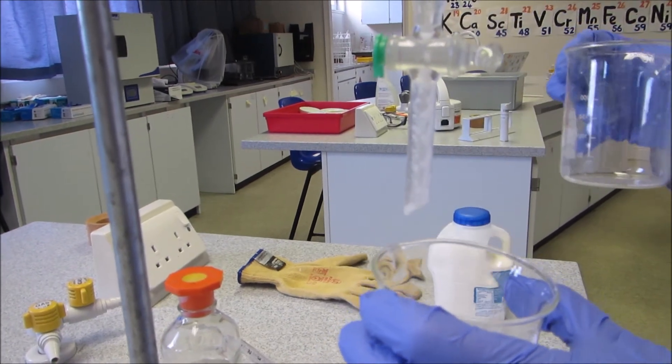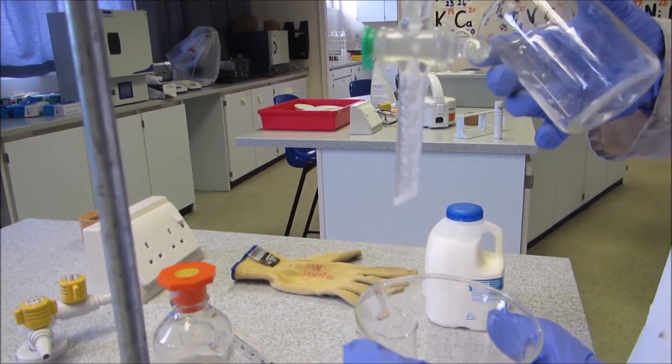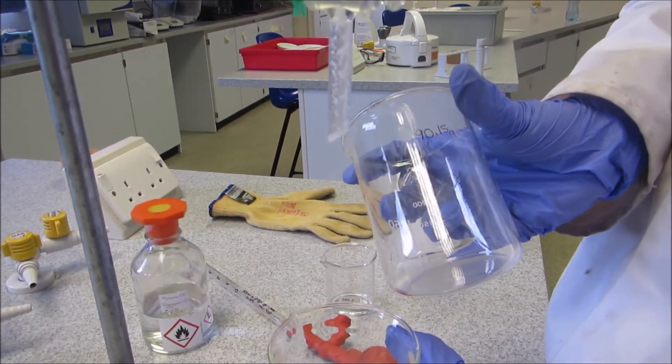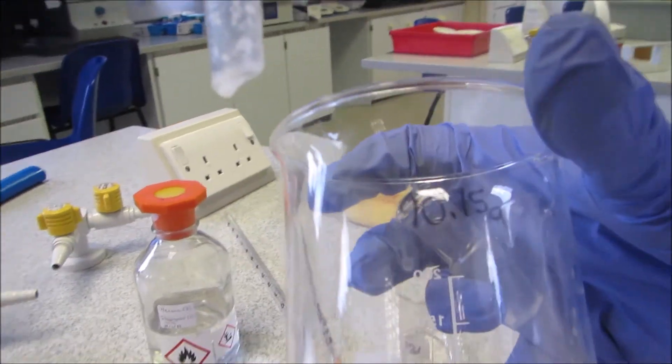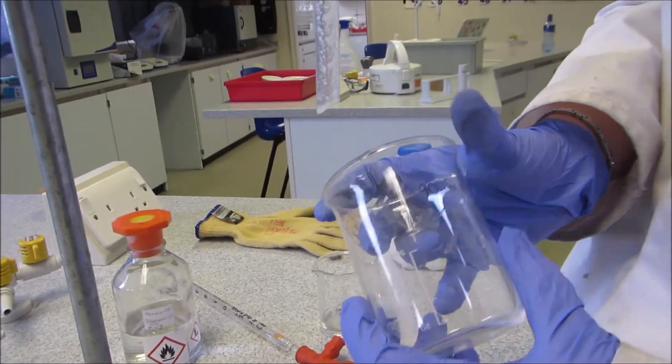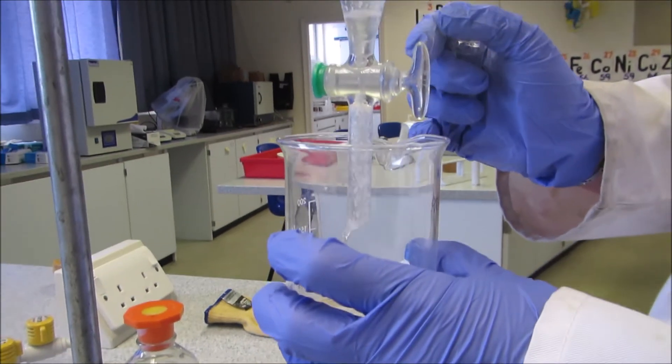So the next one is the one I want to keep. This is our solvent, and it should also have our fat. So I've weighed a beaker, and now I'm going to run the second layer all the way out.